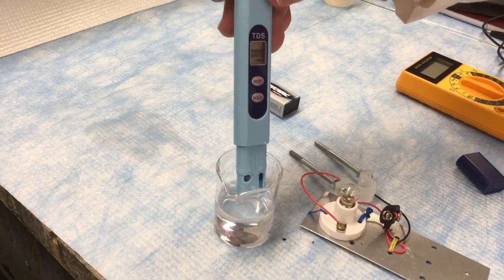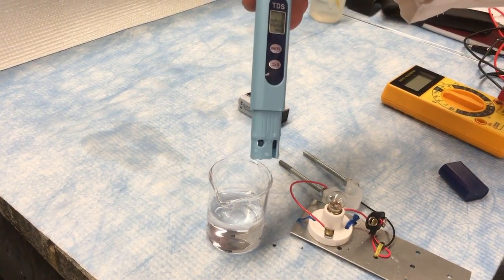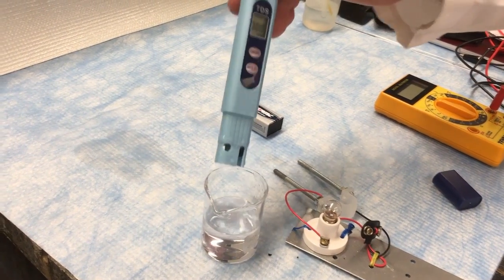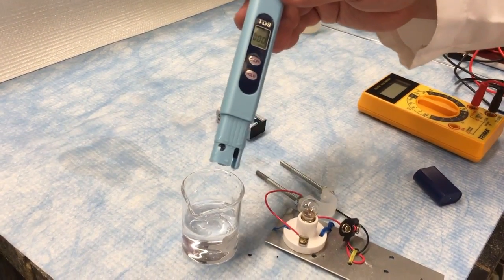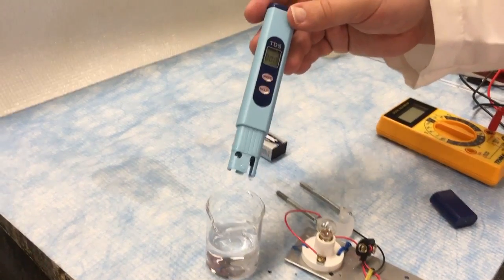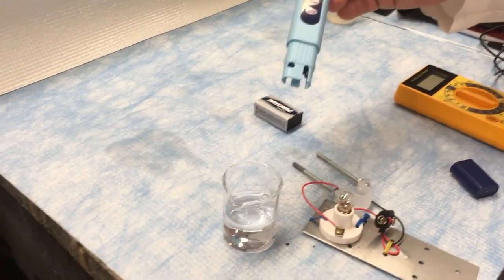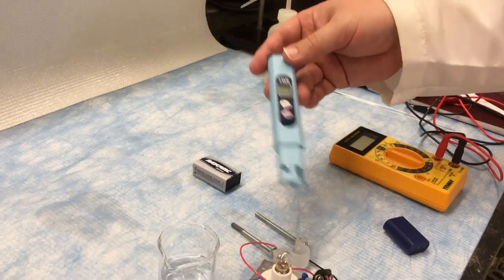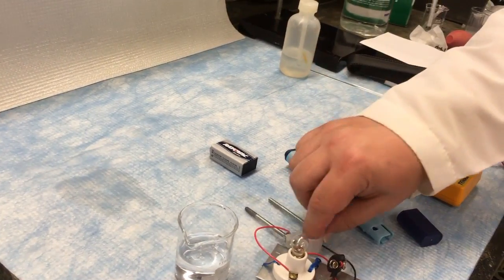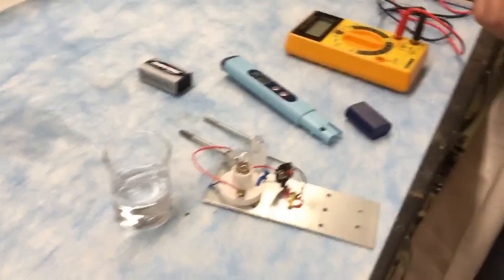Now this is a mistake, I should add. This instrument isn't designed to read as high a salt concentration as we have in that solution. You'll find that as you go through the procedure for the experiment that it won't work, but the advantage of this instrument is that it can read lower ones very accurately, whereas the crude home-built one here is really only good for very concentrated solutions.